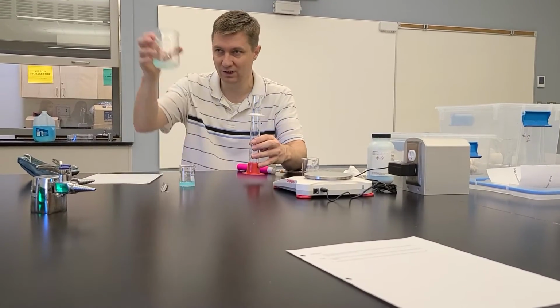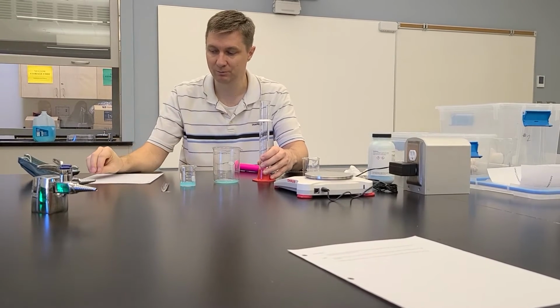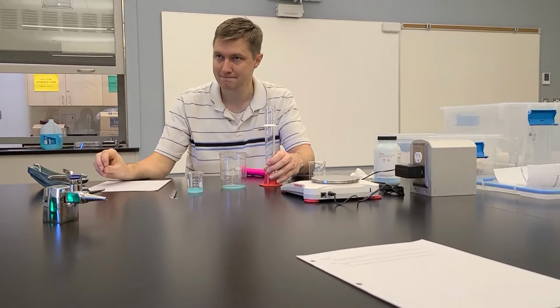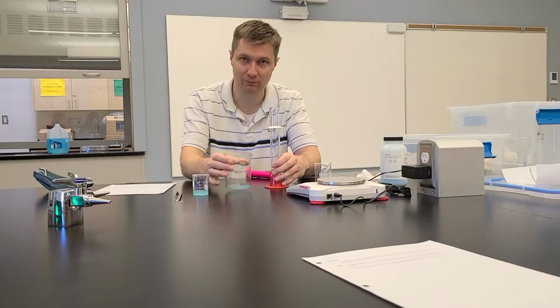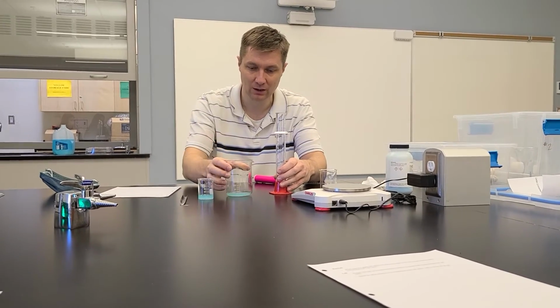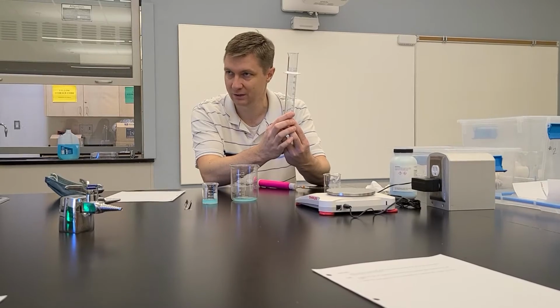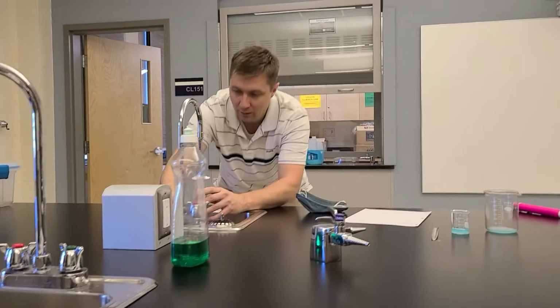So what I gotta do is, again, I gotta do this thing. I know that there's 10 mils in here, and I need the diluted solution to be what volume? 150 milliliters, right? So for the 150 milliliters, I need to add in 140 milliliters of water. Does that make sense? Okay, so I'm gonna go over here to the sink. I can pour in 100 mils.